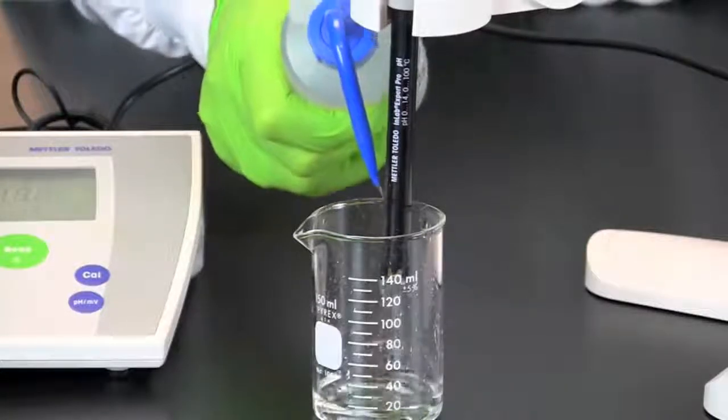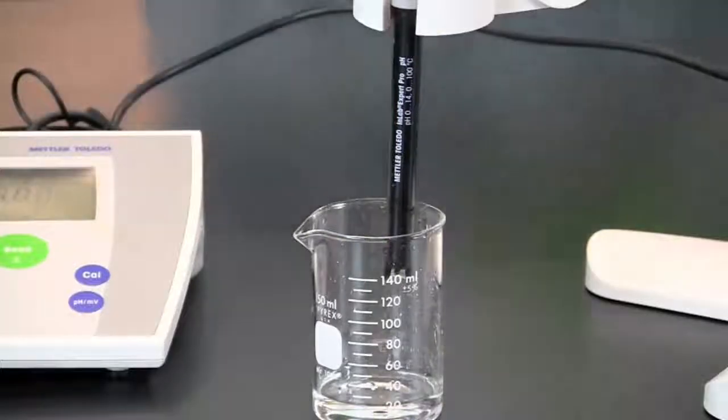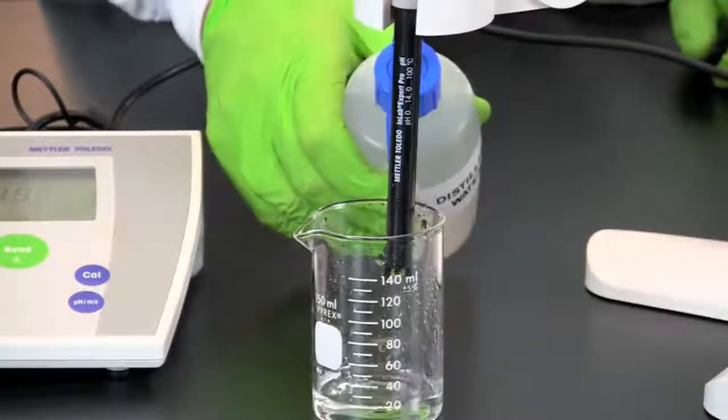pH meters must be calibrated each time to ensure the accuracy of measurements. Using the three different pH standards for calibration provides for a wide range of accuracy.